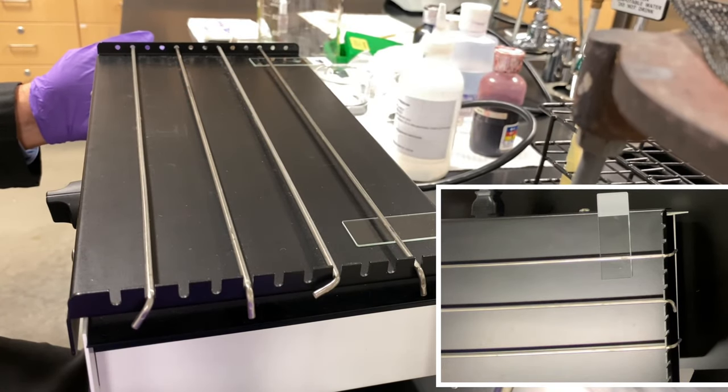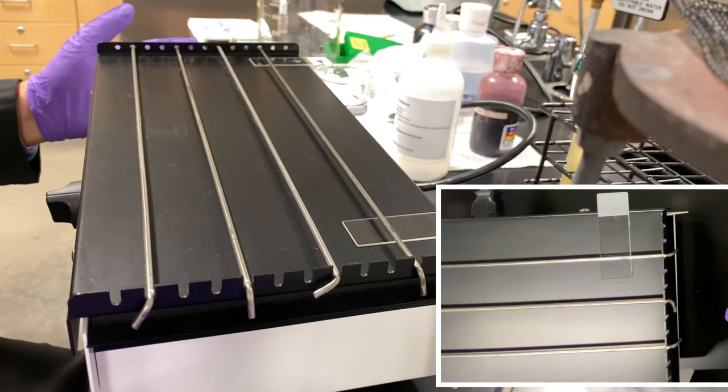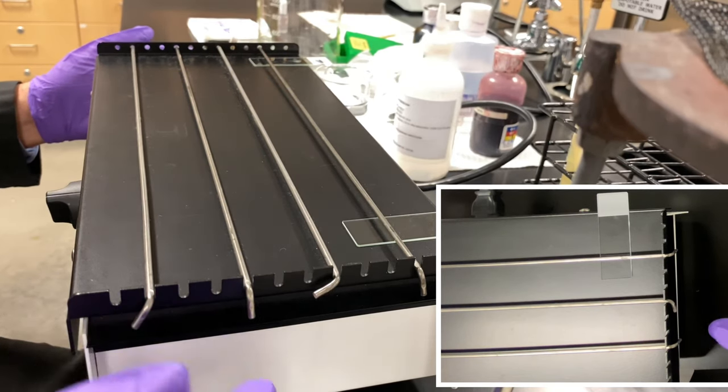The idea here is it's safer than using a Bunsen burner simply because of the open flame, burning your fingers, charring the glass, cracking the glass, and so on and so forth. These are a safer alternative. We'll let it sit there for about a minute.